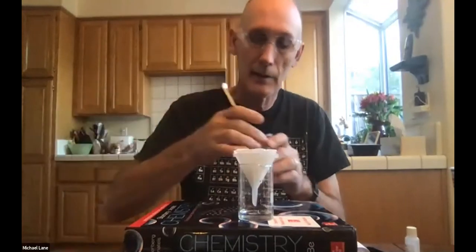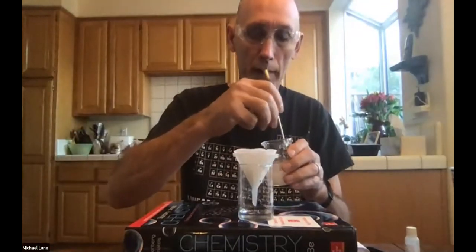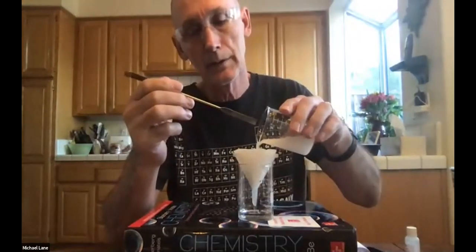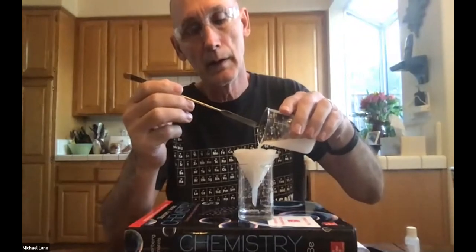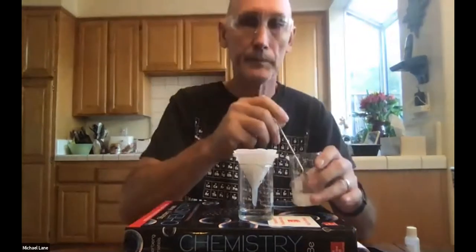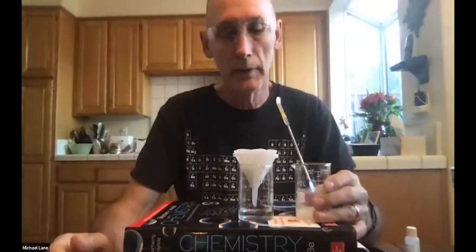So again, you can see at this point why the initial 25 milliliter volumes are not important. We're just going to end up getting rid of it all anyway. And in addition, the more water you use, the longer you have to wait. And while waiting for good results is, of course, noble, waiting for no reason has no nobility at all. Okay, so it's continuing. I'm going to pour a little bit more in there. Again, filling it about 2/3 or 3/4 of the way up the side. And the dripping continues.